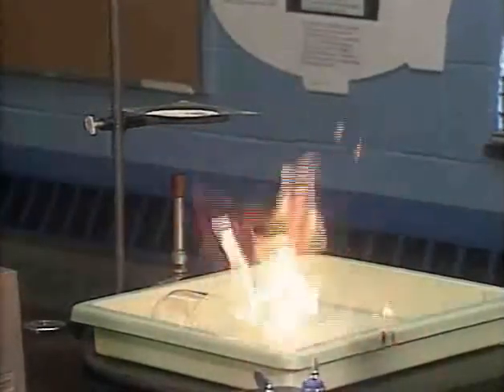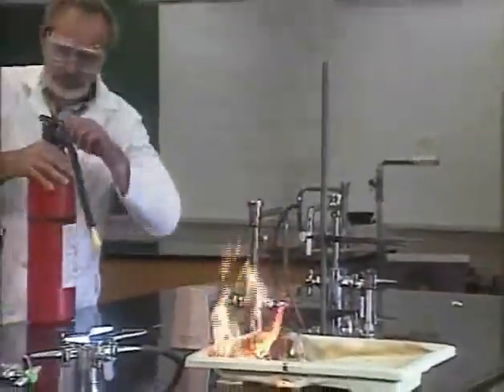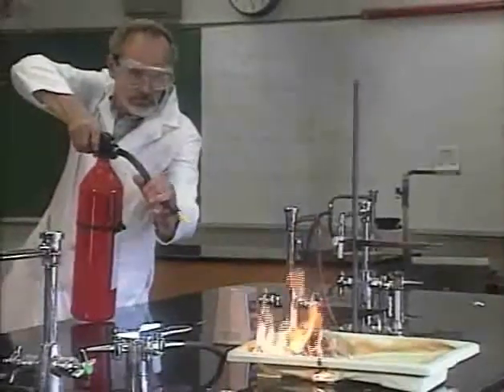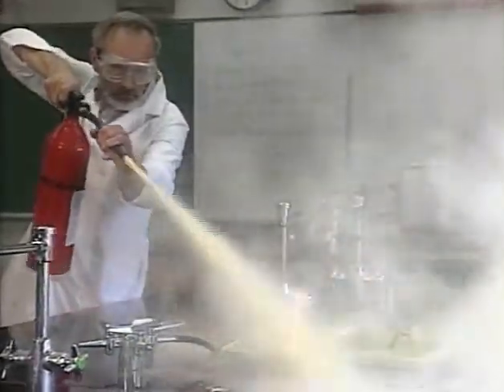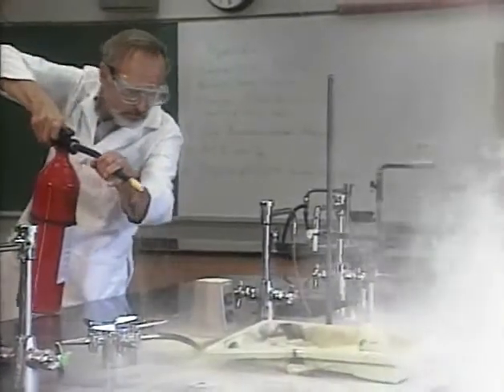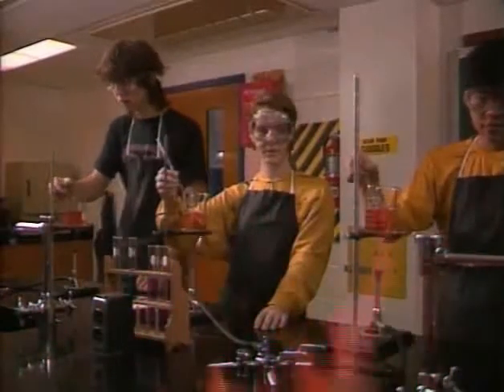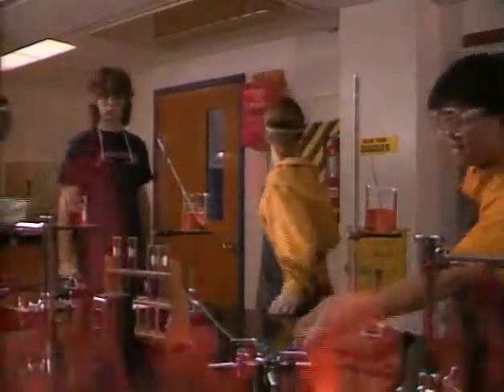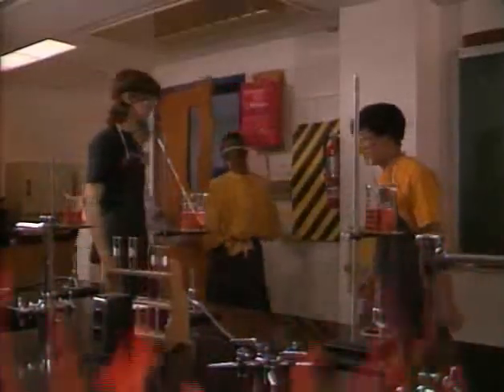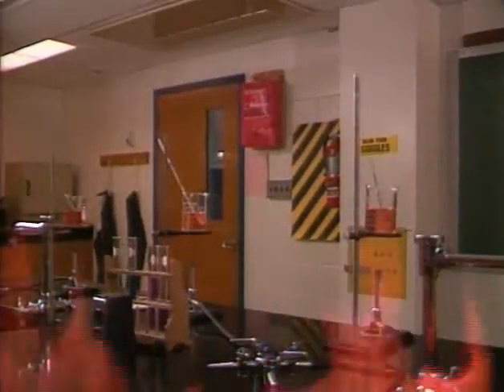Larger fires require a fire extinguisher — it should be operated by a teacher, not by a student. If the fire is too large to control, clear out of the building, call the fire department when you're safely outside, and tell them what chemicals are involved.